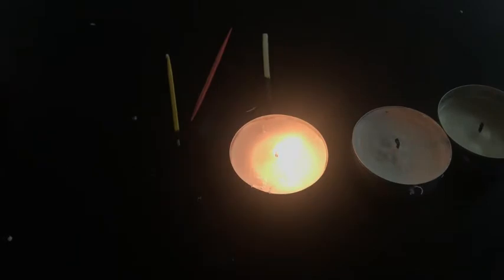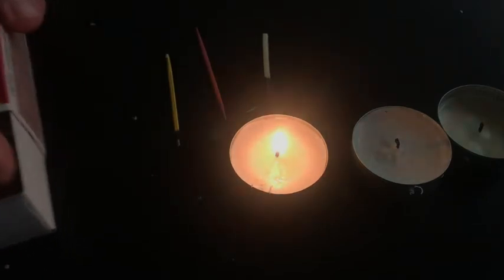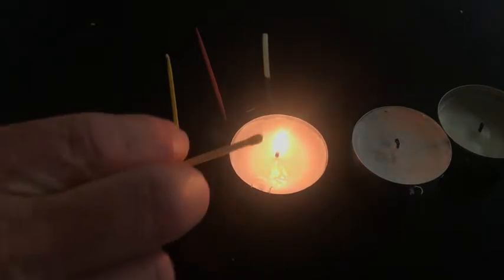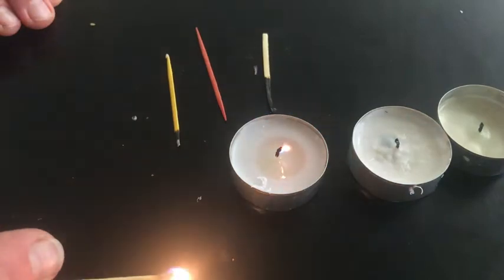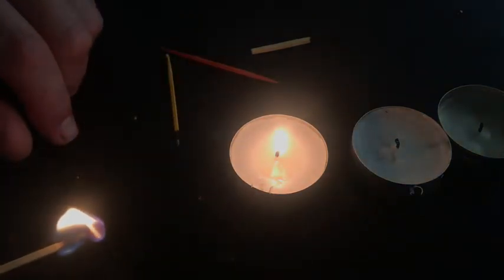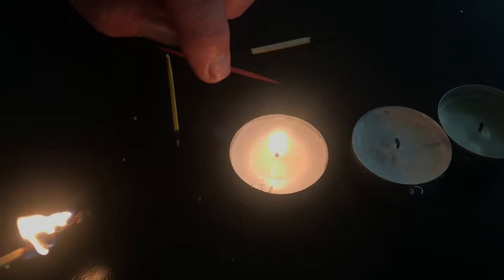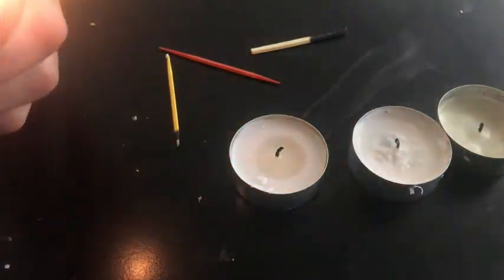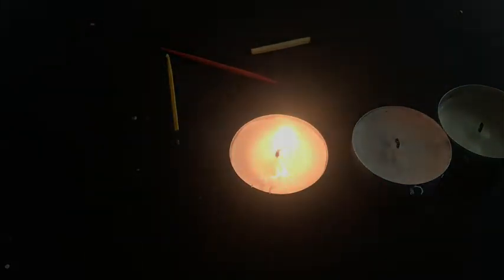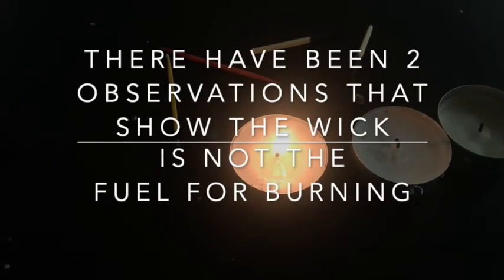So with all this talking, I've let the candle burn for a while, and I want to point out what I had said before. We're going to blow this out again. Need another match. So what's happening to the wick during this burning, right? As burning is happening, I'd see the physical change happening around the outside, but at the same time, that wick is sort of like a participant, but not a participant. It doesn't seem to be changing. Okay, you should stop the video now and go through the questions that lead up to the next experiment.